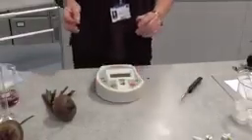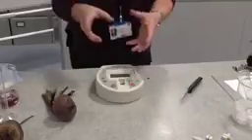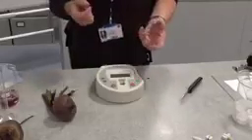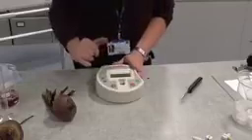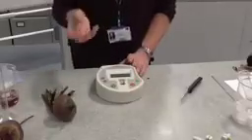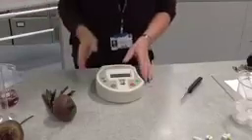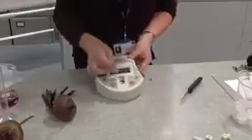Now, a colorimeter is a device that measures the amount of coloured compound in a solution. What it does is shine a light, and you can choose the colour, through a solution, and it works out how much of the light is either absorbed or transmitted. Because we're using a purpley red pigment, we're going to shine a green light through it.